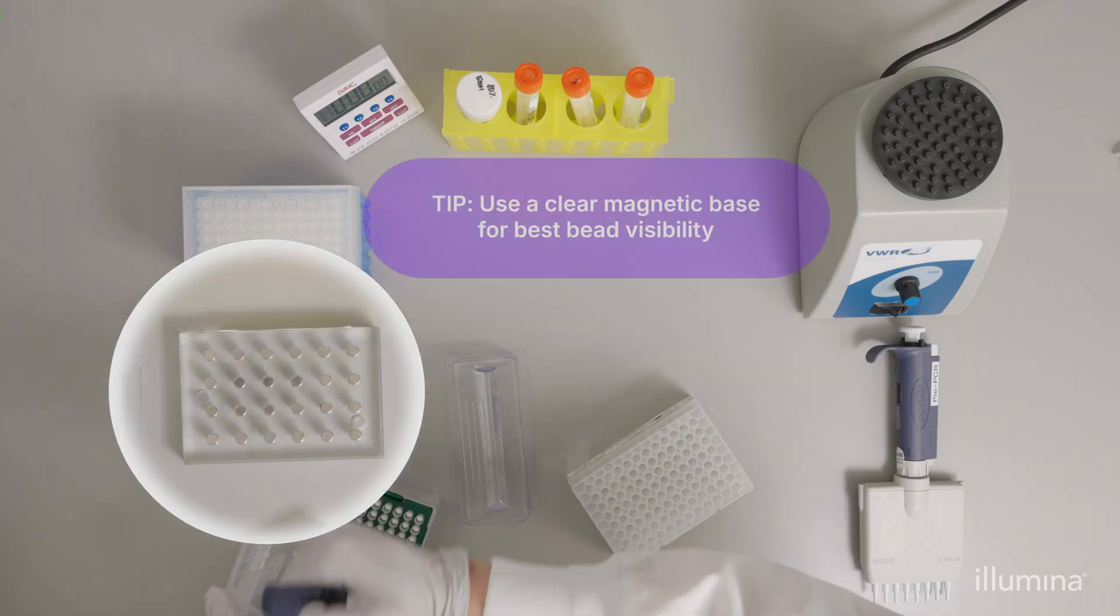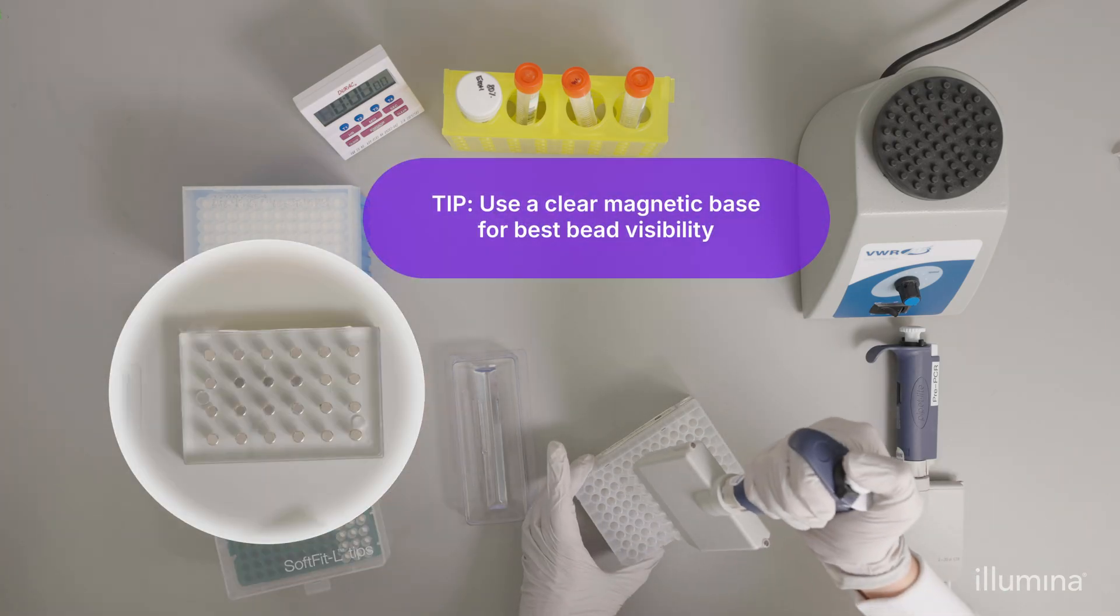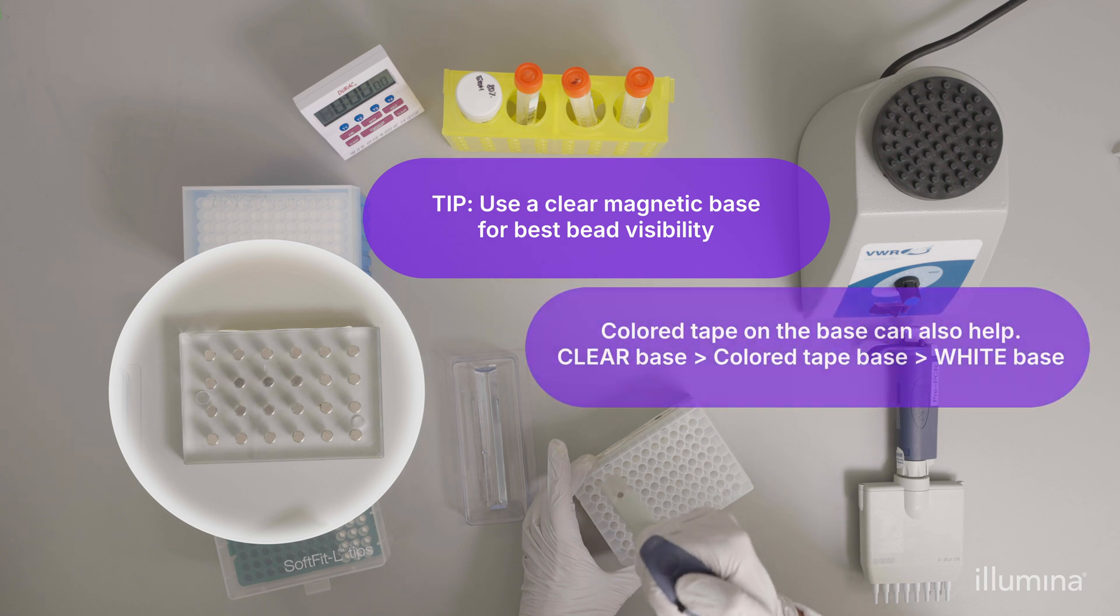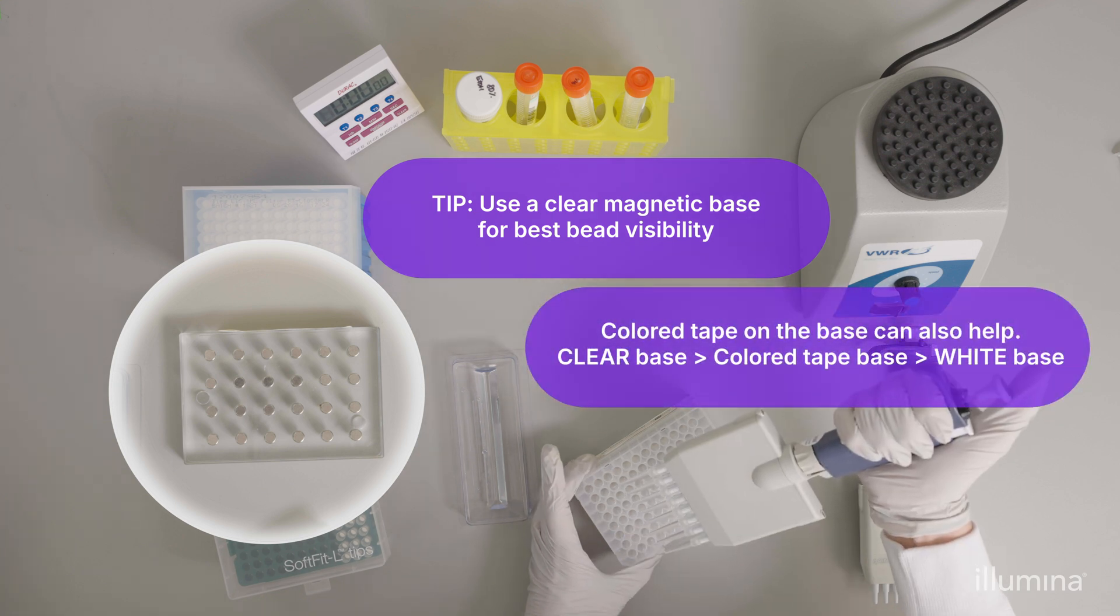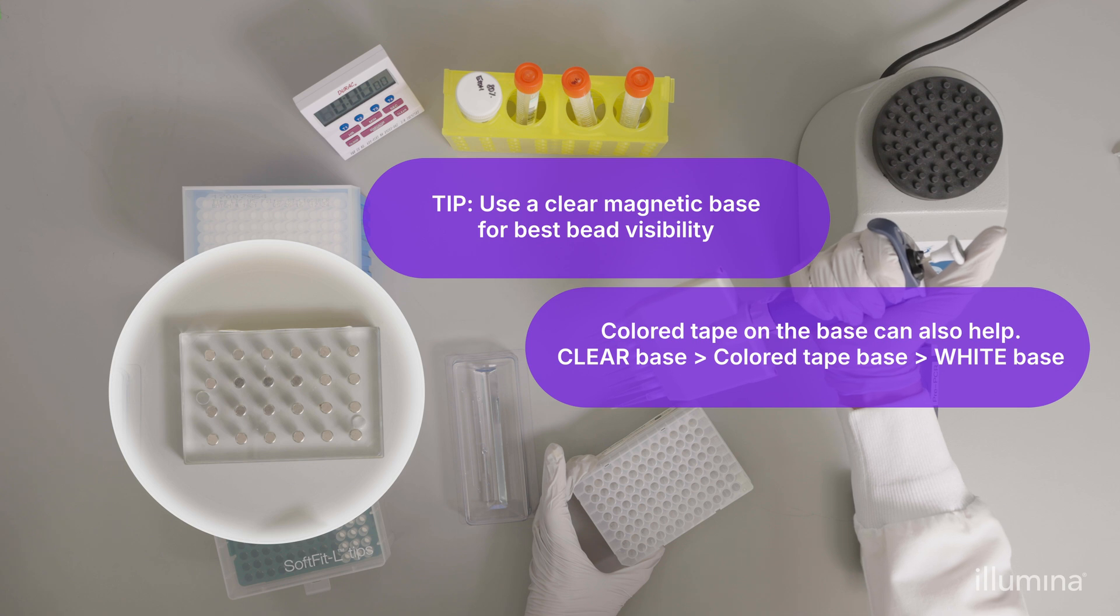The color of the magnetic base can affect ease of spotting remaining liquid in the wells. A clear magnetic base is best, otherwise tape the base with colored tape to better visualize the liquid in the bottom of the wells.